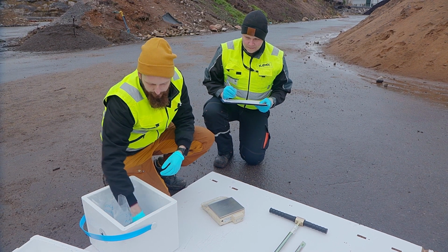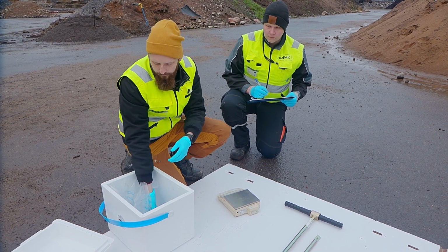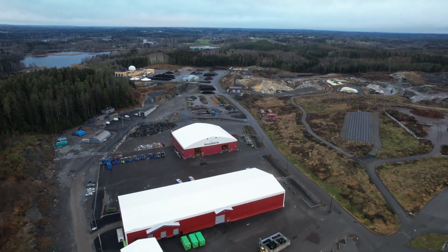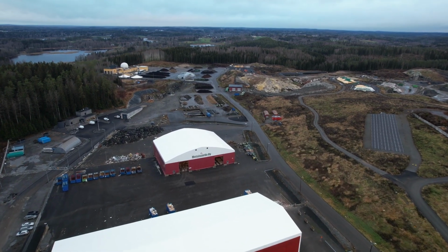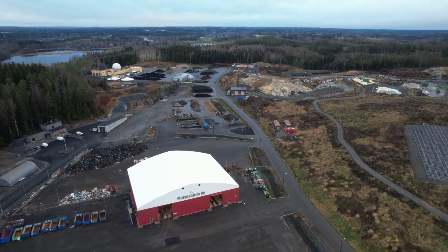In some cases, samples should also be fixated so that the concentrations of the studied contaminants do not change. The samples must remain unchanged until the analysis. The order of sampling should be arranged so that sampling starts from the cleanest area and proceeds to the more contaminated areas, from the lowest to the higher concentrations. This prevents contamination between sampling points.